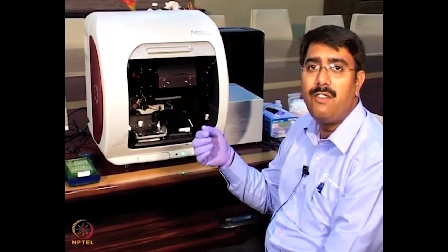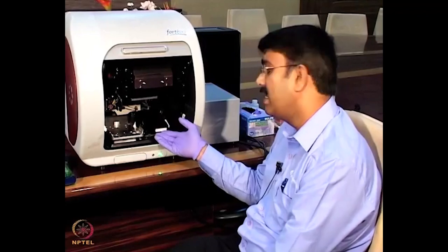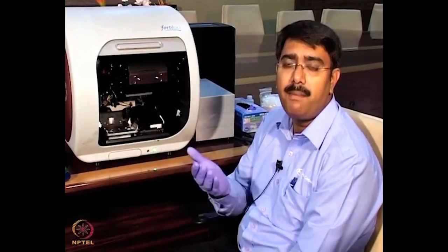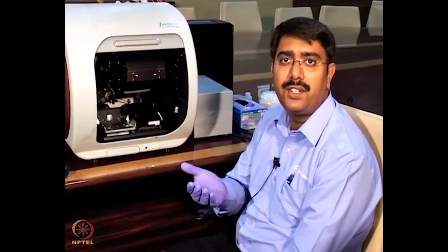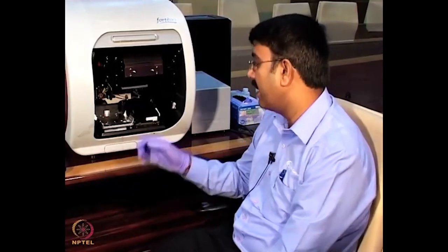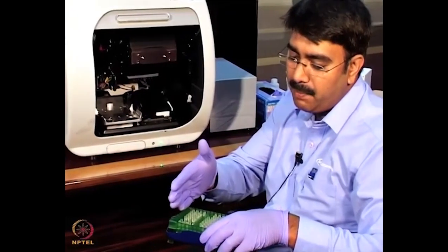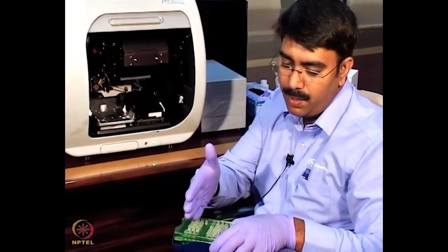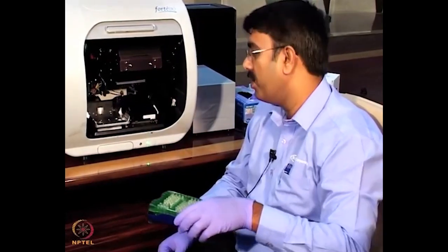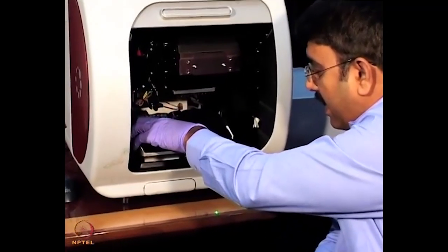The shaker works from 150 rpm to 1500 rpm. Also, the sample plate has temperature control — we can work from ambient room temperature of 23 ±4°C up to 40°C. Now I am going to place the sensor compartment. We pick up the sensors from column 1, 2, or 3, and can program this in the instrument.